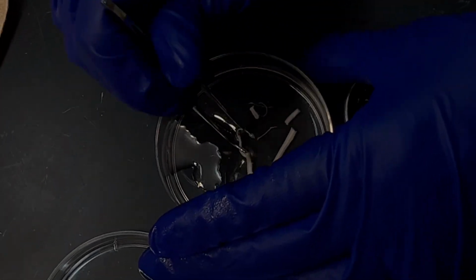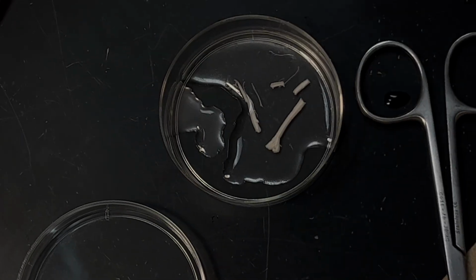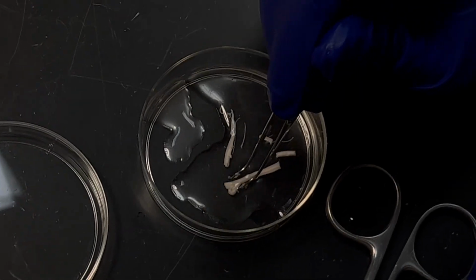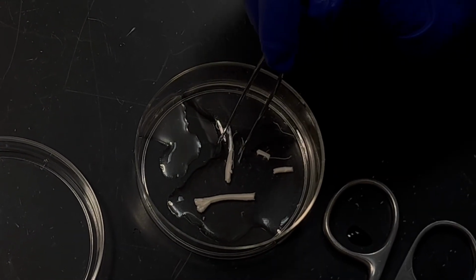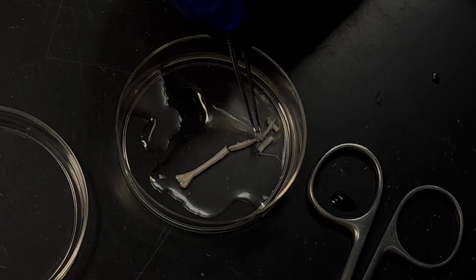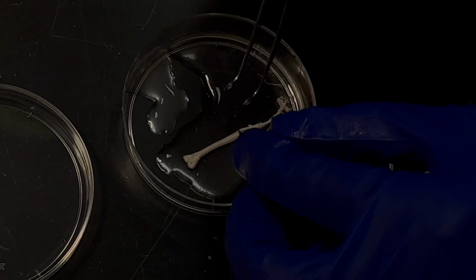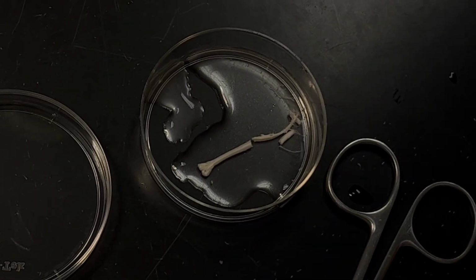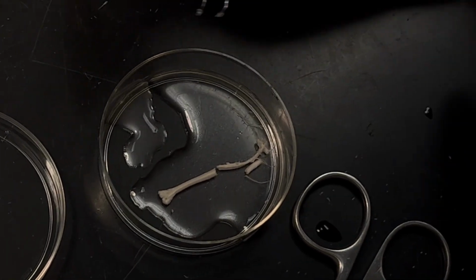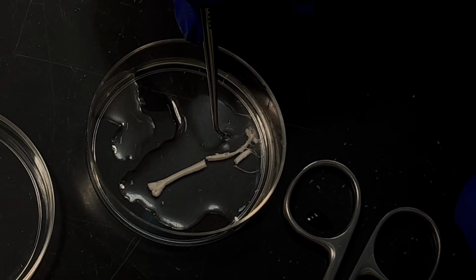Do you see all these nerve rootlets coming out? Yes. Like right here. So let's try next time to have a more intact one, but essentially where I cut is here. I take this part where things got a little bit fattened. That's the lumbar enlargement, which is right at L3 and L4. Okay. And that's where I would cut. So I'll make one cut here, and I'll make one cut here.